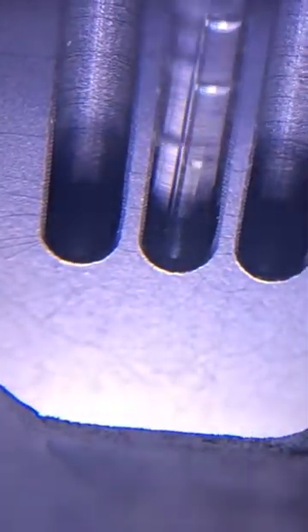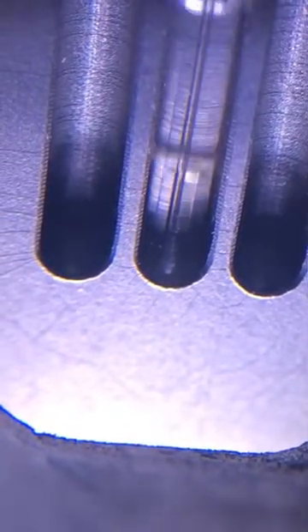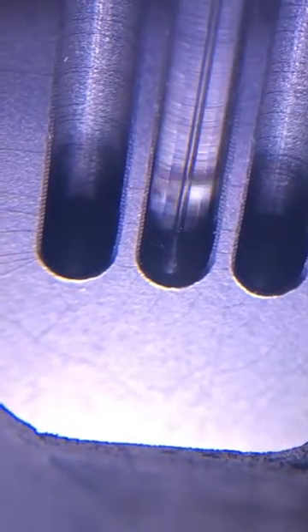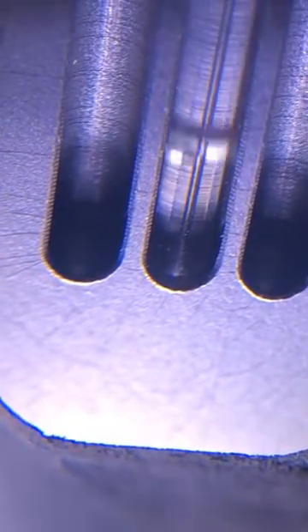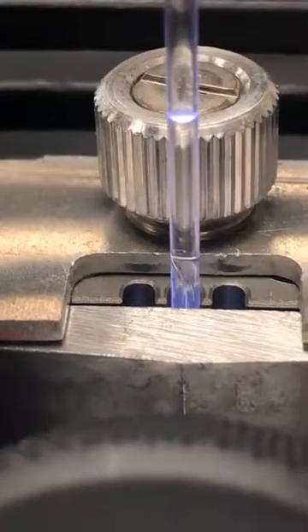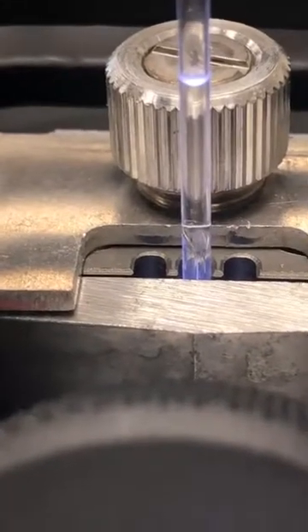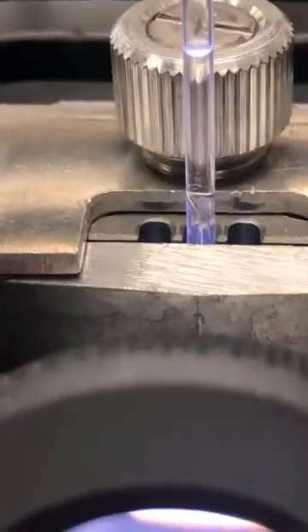That's not boiling, actually. That's actually bubbles that are forming inside the capillary as a result of the expansion of gas in the capillary. Oftentimes you'll know it's that kind of bubble because if you look at the top of the capillary tube over here, you'll see bubbles rising out. Now what's happened here is I had too much liquid in it, so it's pushed that liquid up. But those bubbles that are rising through there are not boiling. It's just toluene and air vapor that's coming out from this tube.